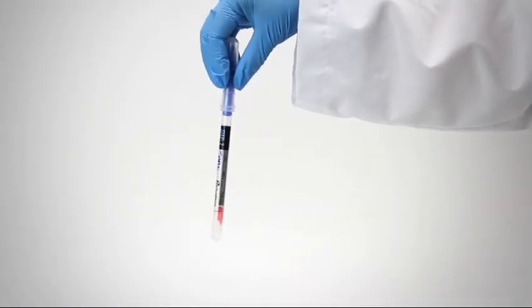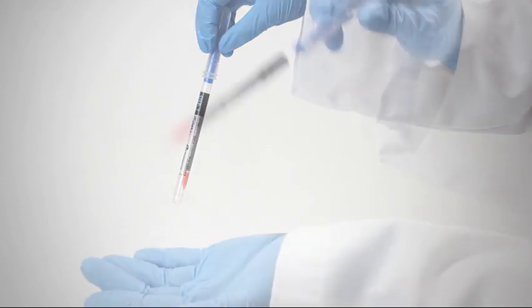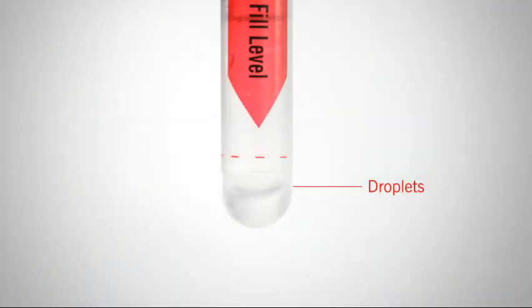Holding the tube upright, forcefully flick the device in a downward motion or tap on the palm of your hand 5 times. This will bring droplets of chemistry to the bottom of the tube.